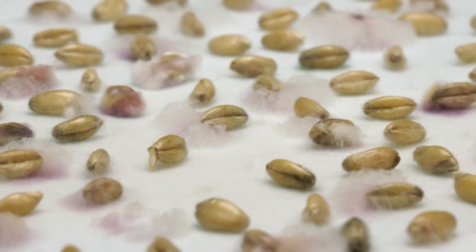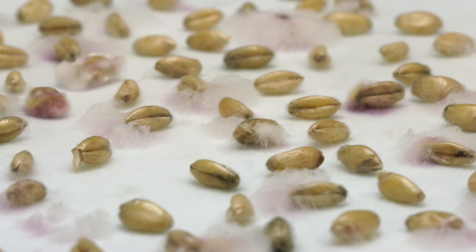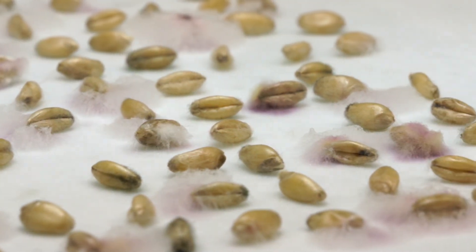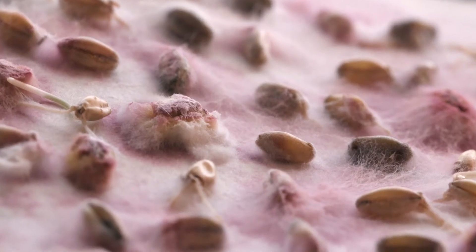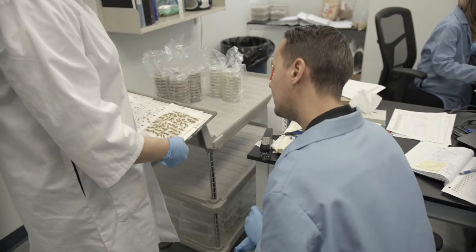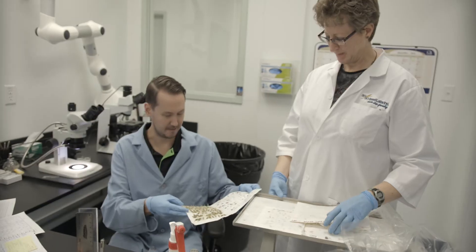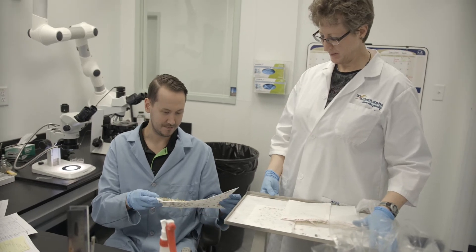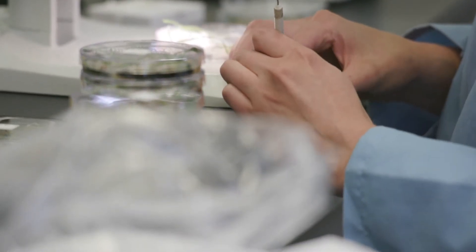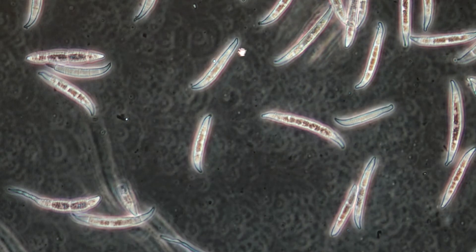The normal seedlings in proximity to infected seedlings may be impacted by the disease, resulting in weak seedlings. Once we determine that Fusarium graminearum is potentially present, we send the sample for further disease testing in our pathology laboratory, where our disease diagnosticians can determine the percentage of infection.